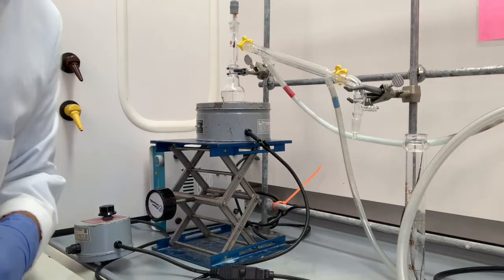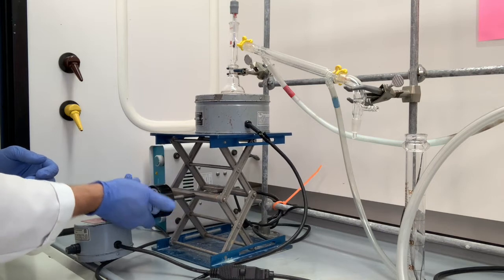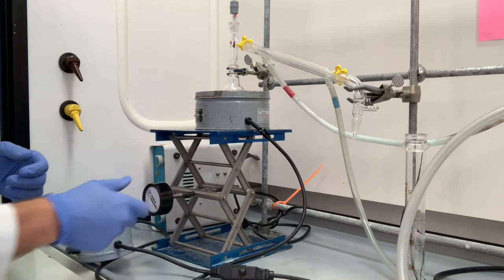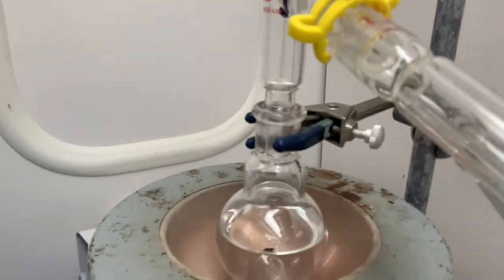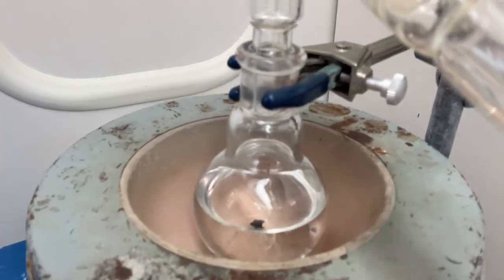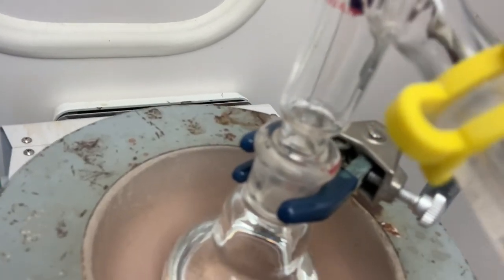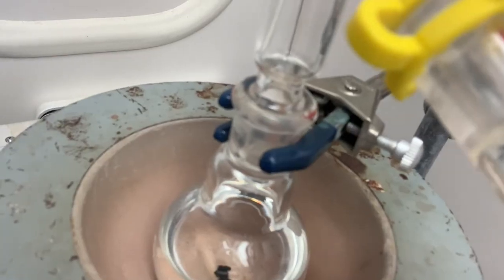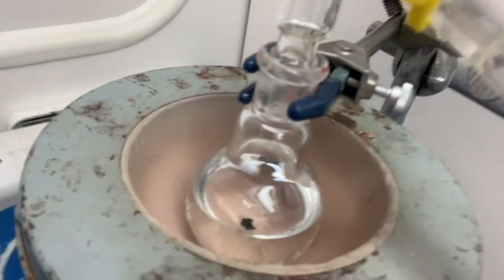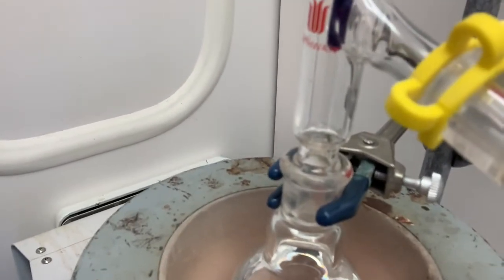So we're just about ready to begin. What I'm going to do now is lift this thermowell. I'm going to move the camera so we can see this a little bit better. We're going to lift the thermowell, and we don't want this to be really forced up against the glass, but you want the bottom to be just barely touching. I'm actually going to go down just about a millimeter. We don't want to be forcing those together to create any stress in the glass.